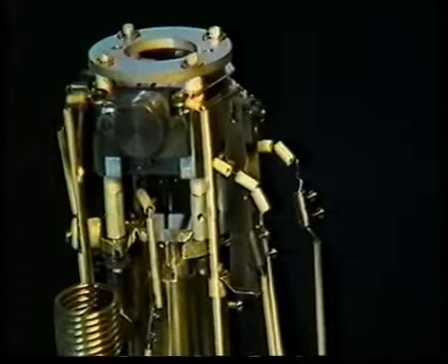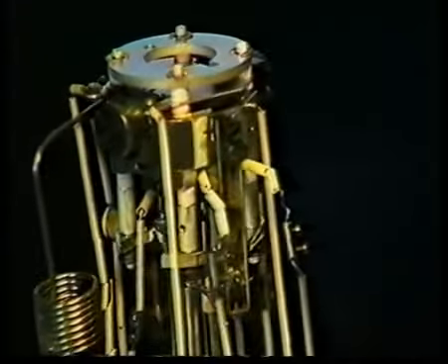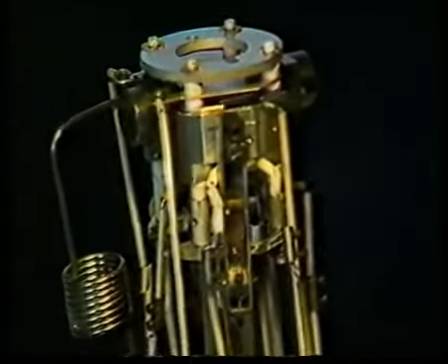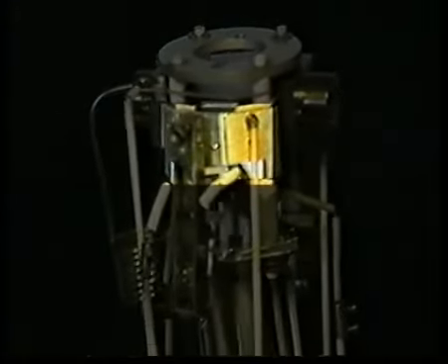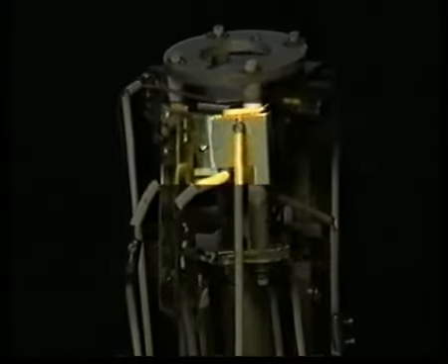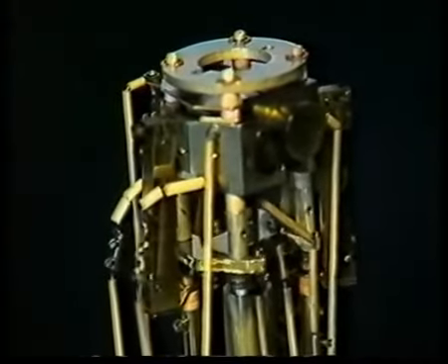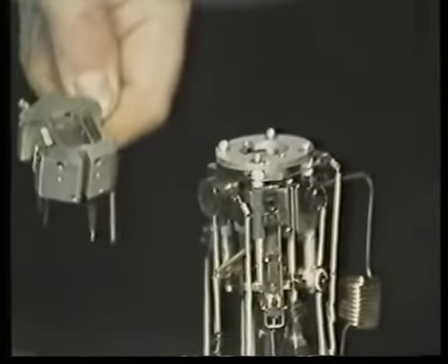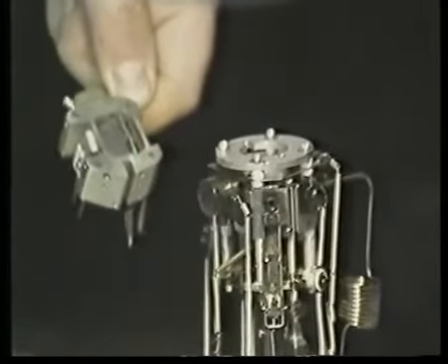You can see here the source fully removed and upright so that it can be seen in more detail. The electrodes look complex, but are many and varied in order that the different types of sample can be handled and analyzed. In the middle of the apparatus is the ion block, which you can see here highlighted. This is where the ionization actually takes place, and is a type of ionization chamber. Here is another view where on the left we are showing another separated ion block. Let's now look in detail to see how it works.